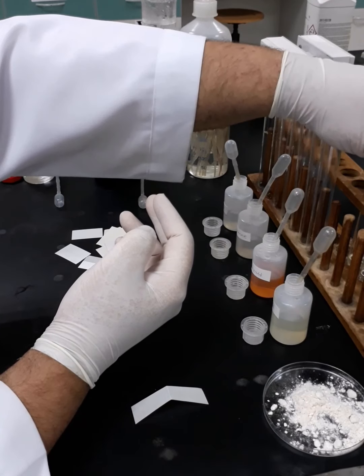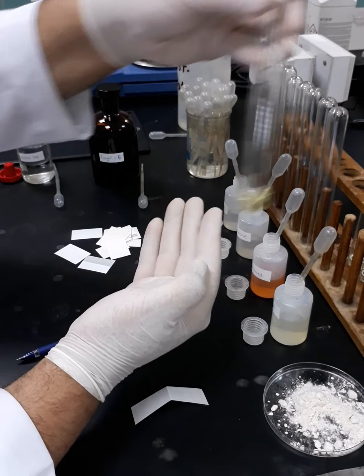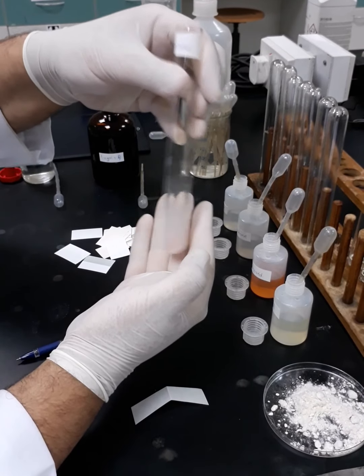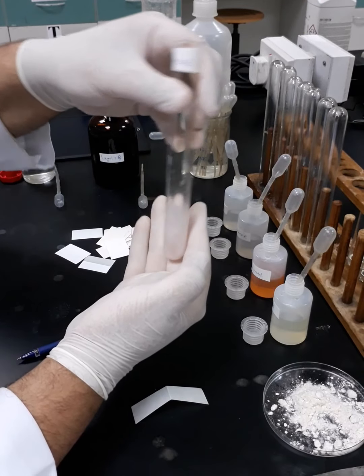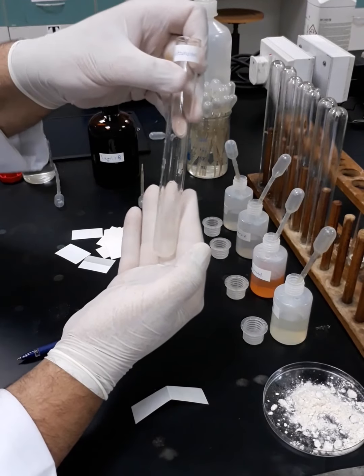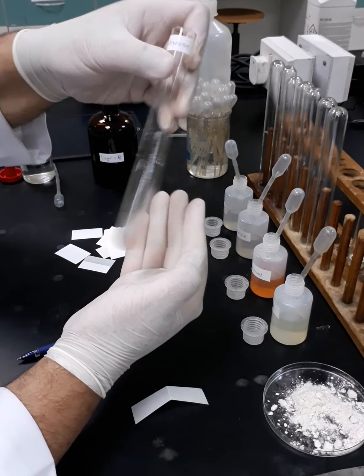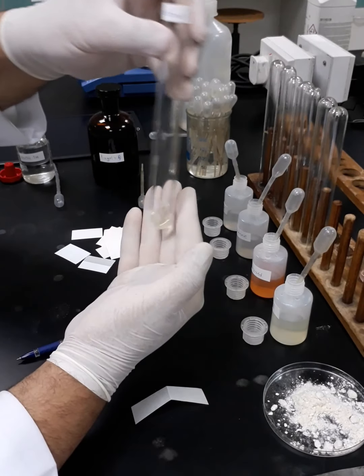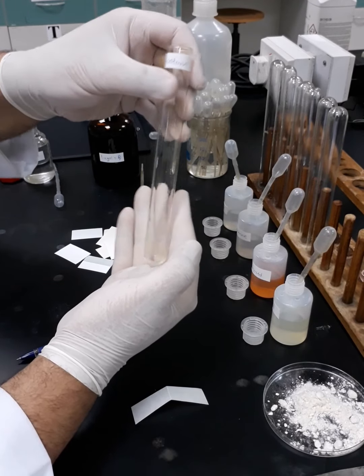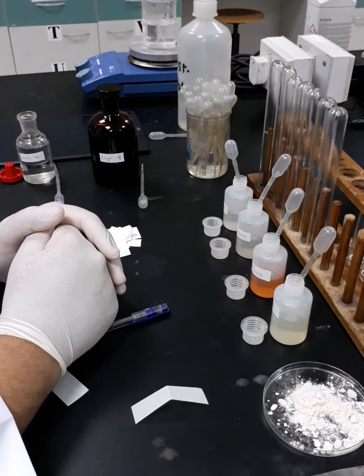So now we are sure that the media is basic. Okay, next we are going to boil on a water bath for 1 minute.